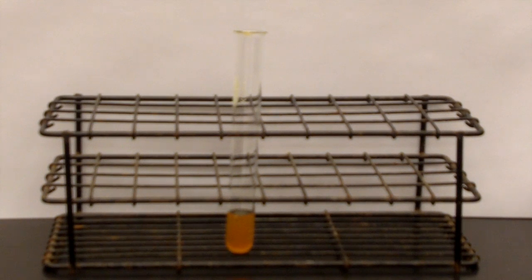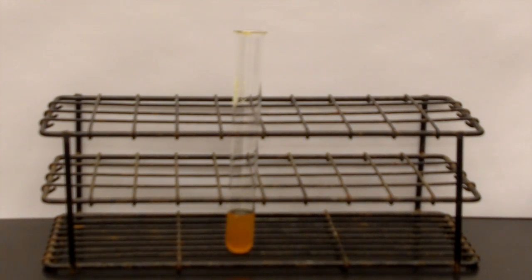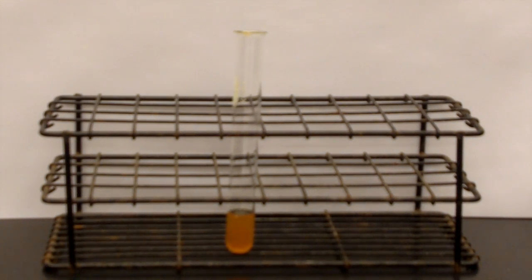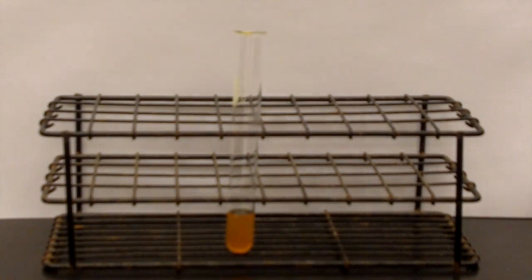Now we have a solution of iron chloride, and we're going to react that with sodium hydroxide.